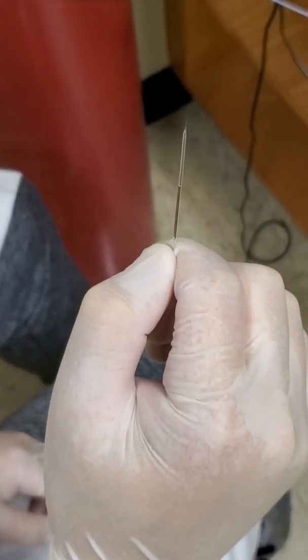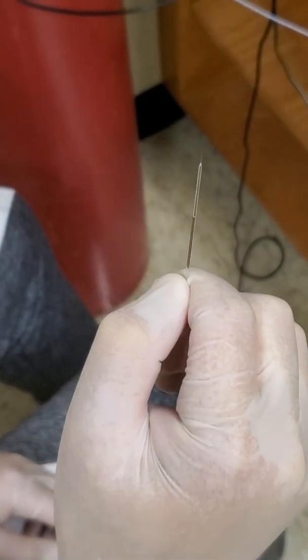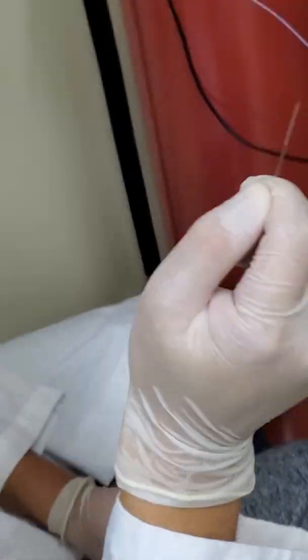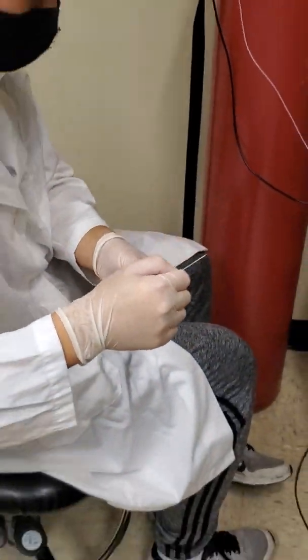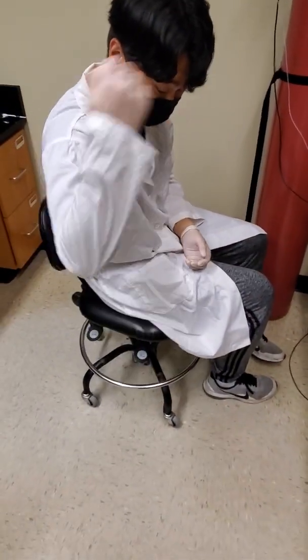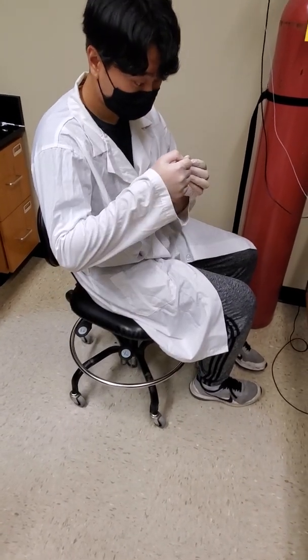Let me get a good look at this needle real quick. If it will focus, we'll see. Okay, there you go. Now you can see it. And you see the liquid is not at the tip yet. So Josh is going to have to fling the needle downward several times in order to get the liquid to go all the way down to the tip of the needle.